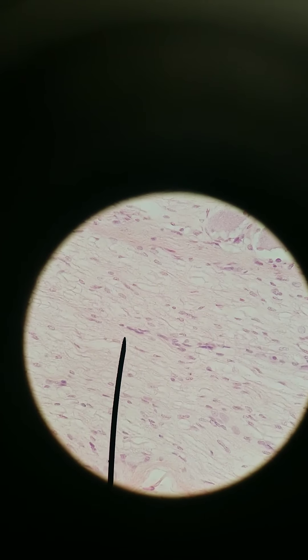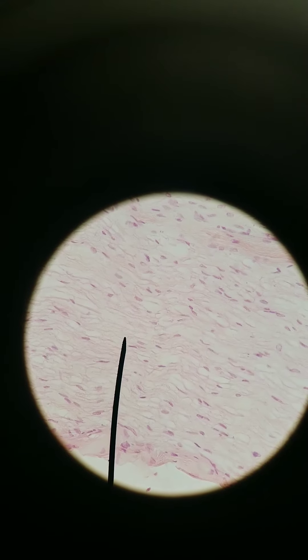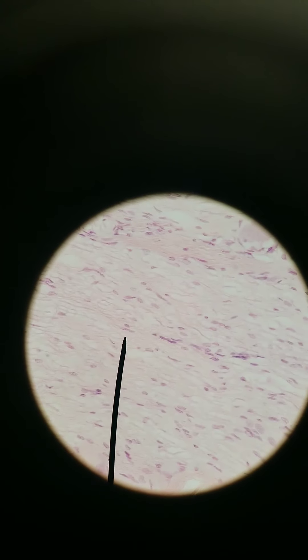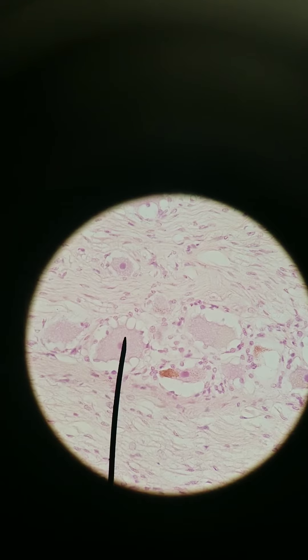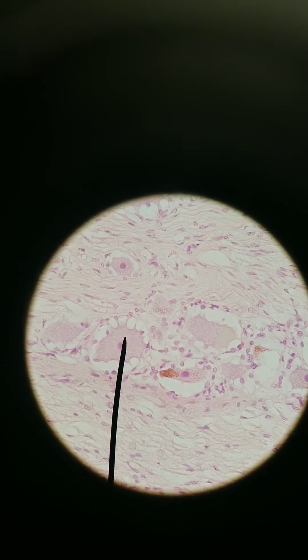The cell bodies you see along the axons — those are Schwann cells. Schwann cells are providing the myelination for these axons, so they're going to be along the axons. You can see them following these directions. So the axons have Schwann cells to provide the myelin, and the neurons are encircled by satellite cells, orbiting around providing nutrients and getting rid of waste.